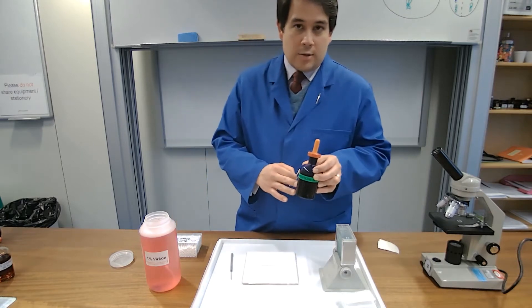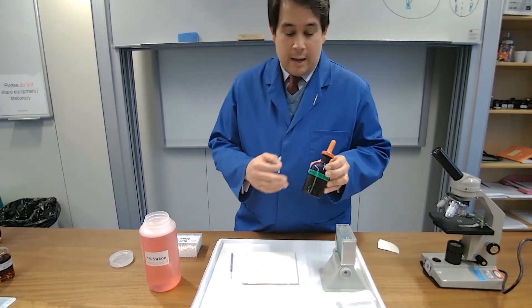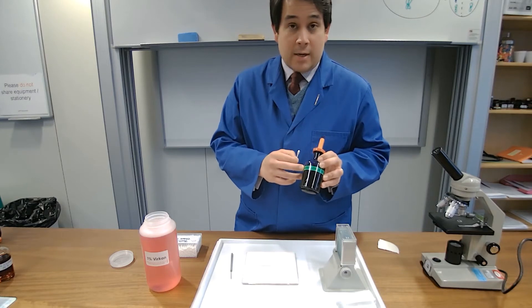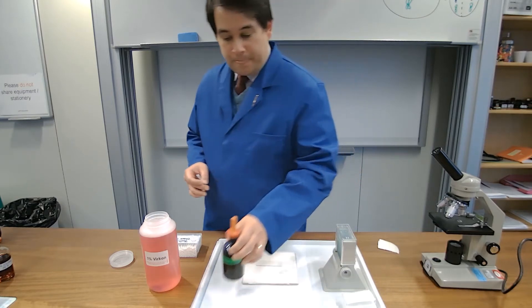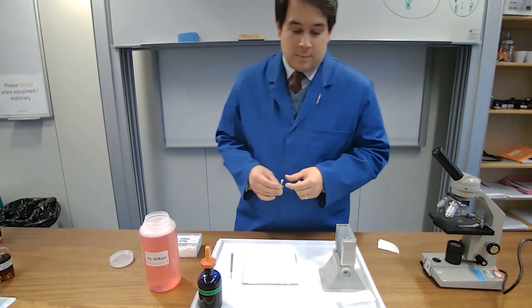So this adds contrast to our image and helps to - methylene blue in particular helps to stain nuclei, so the nucleus becomes much more visible as well.